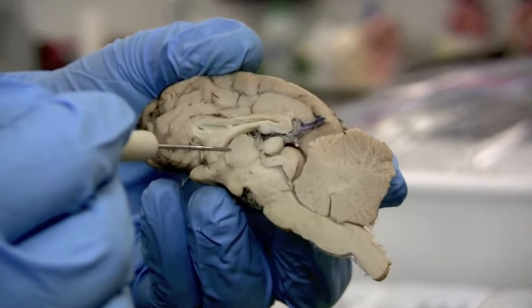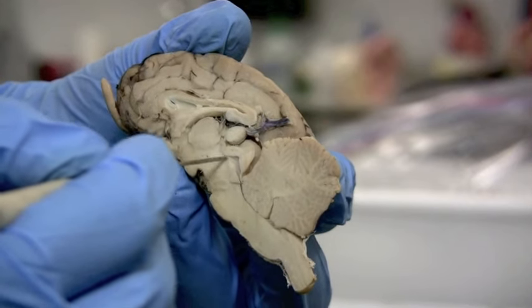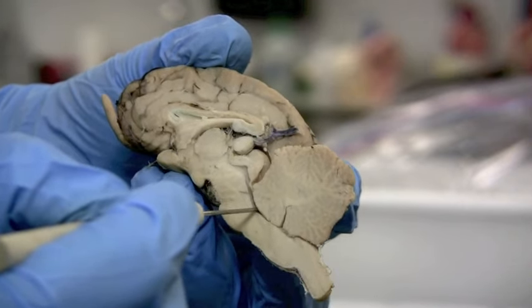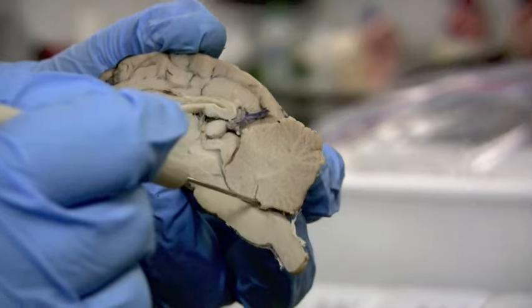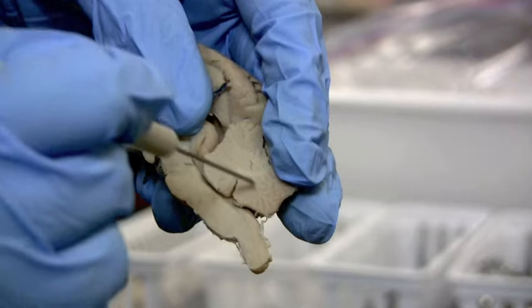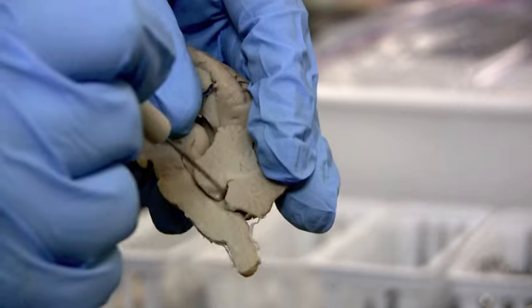The aqueduct of the midbrain connects the third ventricle with the fourth ventricle and comes down around the thalamus. It's this connection right here that you can follow down. It goes in between the rest of the brain stem and the cerebellum. The aqueduct of the midbrain is this canal, and it empties into the fourth ventricle, which is right here in this indent of the cerebellum — a more wide open space. That's the fourth ventricle.